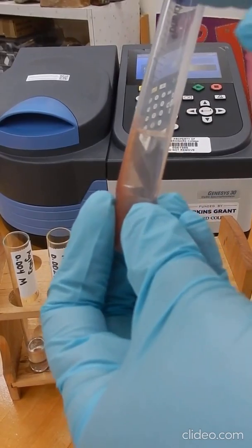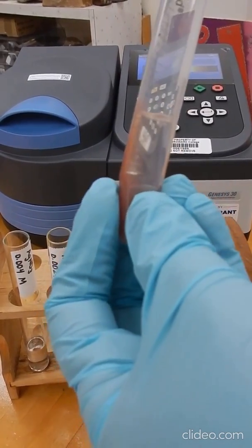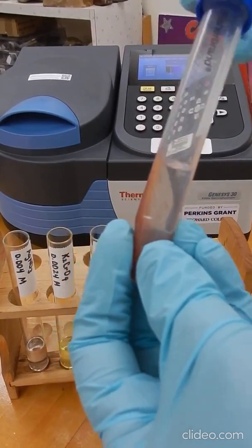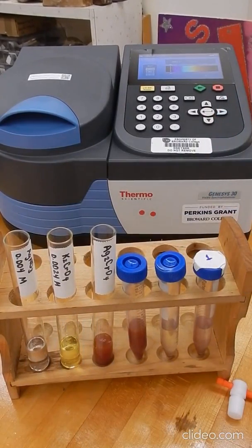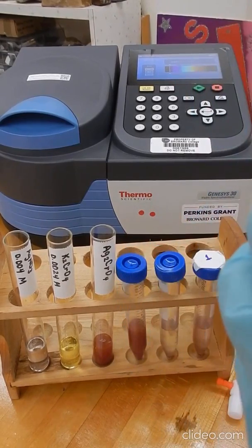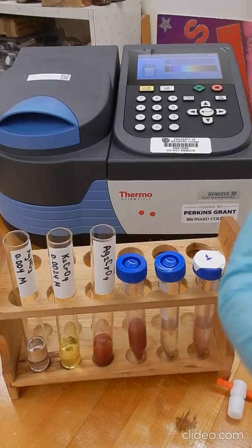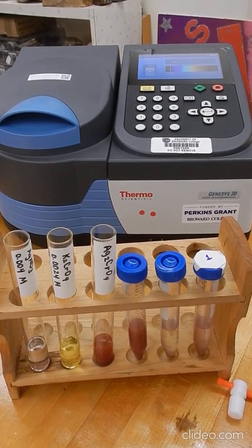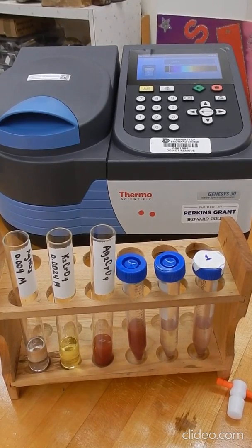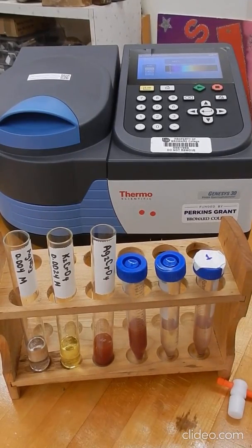But now we're not discarding that liquid. Now we're actually transferring that liquid into a cuvette so you can determine the absorbance of your sample. So I have here my sample in a cuvette that I already transferred, and now we can just measure the absorbance for your sample that you have in your cuvette, and that's the absorbance that we're using for the chromate ion. So that absorbance corresponds to the chromate ion that is actually in solution, because the silver chromate is dissolving to give you that amount of chromate ions in solution.